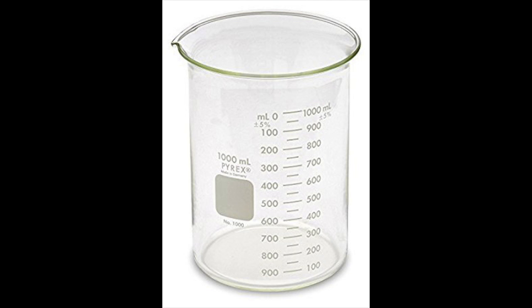To show the change in pH due to the formation of acid, we will use the indicator Bromthymol blue. In a beaker of water, the indicator will make the solution appear blue. When acid is formed, the solution will turn a yellow color, indicating a change in pH.